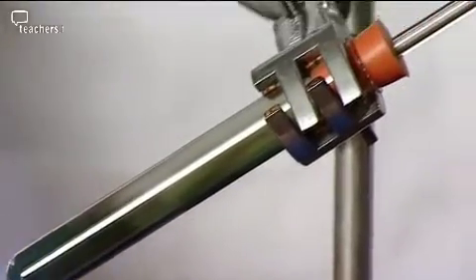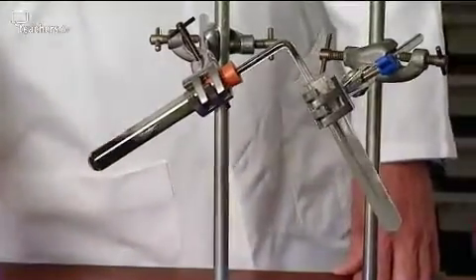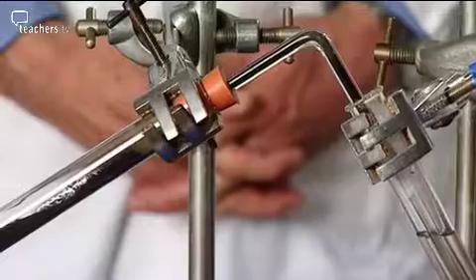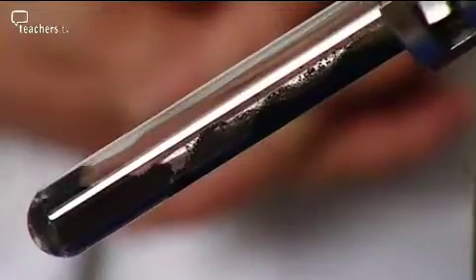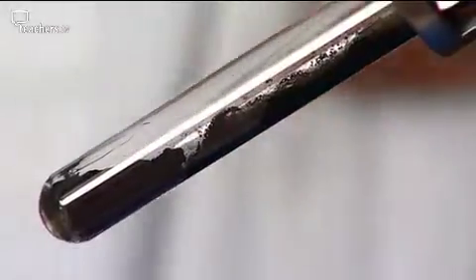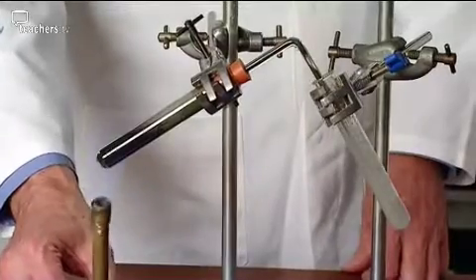Also at number 9, another common experiment at risk from suckback. It's heating copper 2 carbonate to produce carbon dioxide, which is bubbled through lime water. And once again, if you remove the heat, it has cracked the test tube. As soon as you stop heating, you can either take the test tube away or take the delivery tube out. Heating in a hard glass test tube and using less lime water also reduces the risk of the experiment going wrong.